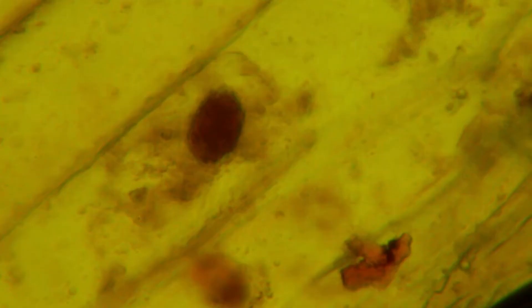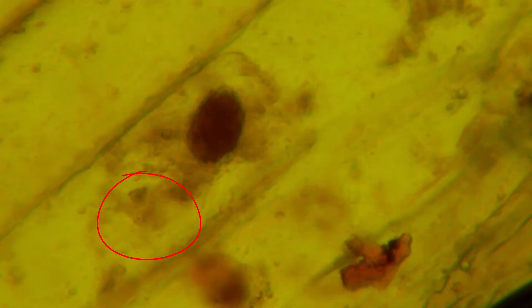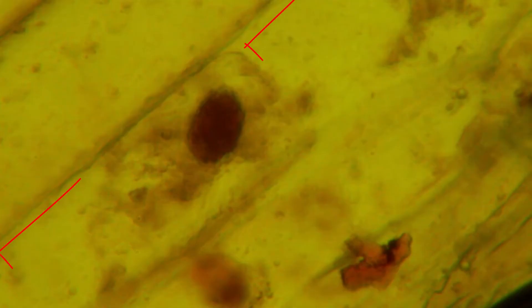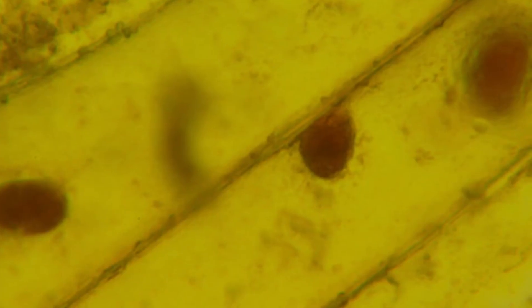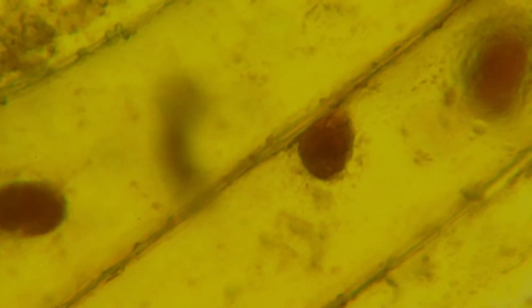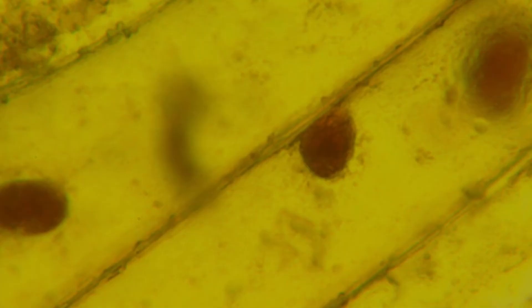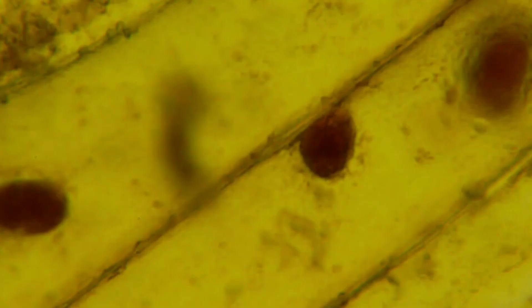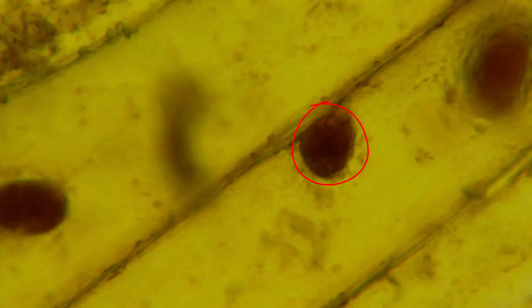Inside the cells at the high power, we can see the cytoplasm. If we change the focus of the microscope, we can see a big vacuole — a big empty space inside the cell. Sometimes these vacuoles take up most of the space inside the cell. The nucleus is usually attached on one side of the wall, on the inside of the cell, and they are fairly large sized nuclei.